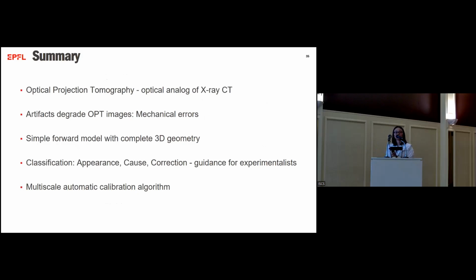And to sum up, we talked about an imaging modality called optical projection tomography. It's an optical analog to X-ray CT. The OPT reconstruction images sometimes suffer from artifacts, in particular due to mechanical errors in the imaging system. We used a simple forward model to describe the 3D geometry of OPT. Then we use this model to classify the different types of artifacts according to their appearance, their cause, and the correction methods. This provides guidance for experimentalists to have an insight into the system. And in the end, we propose a multi-scale auto-calibration algorithm to remove the artifacts.